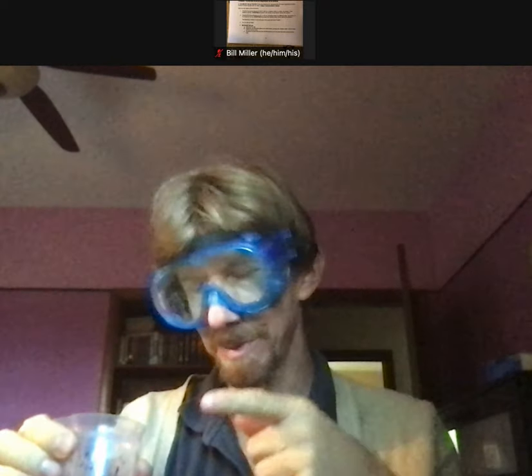Since these pHs are a little different than the pHs in the procedure — I'm going to do it right here. I've got my water and reading along in the procedure it talks about dissolving packets, but we don't have to dissolve packets because we have actual pH buffers already made. I'm going to put a little bit of this water aside for rinsing things.